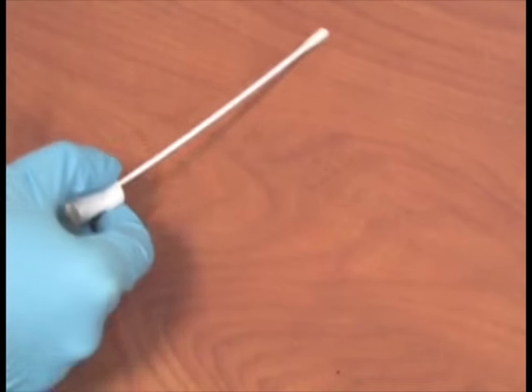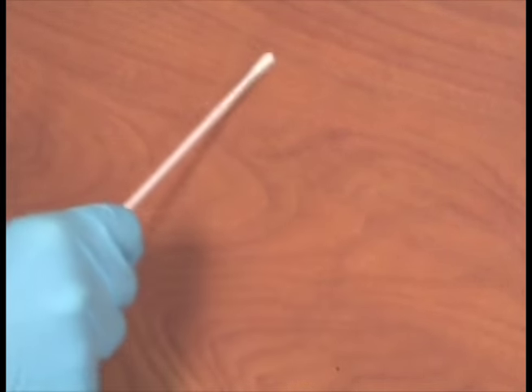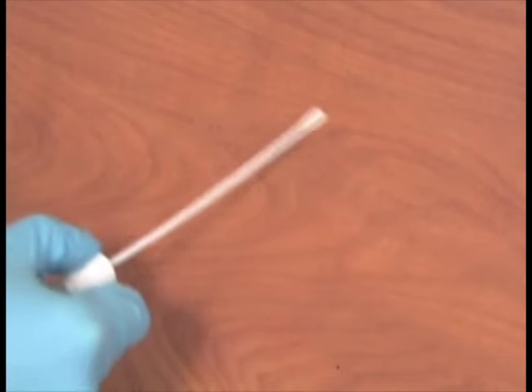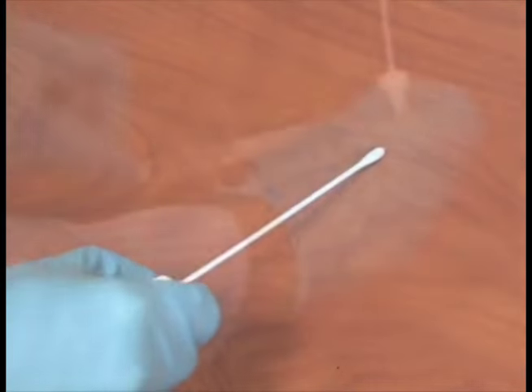Four, swab the entire area in a zigzag pattern, rolling the swab over to ensure the entire swab is used.